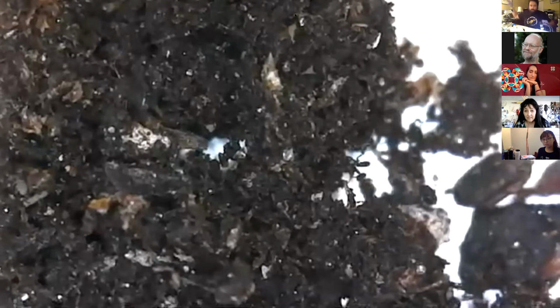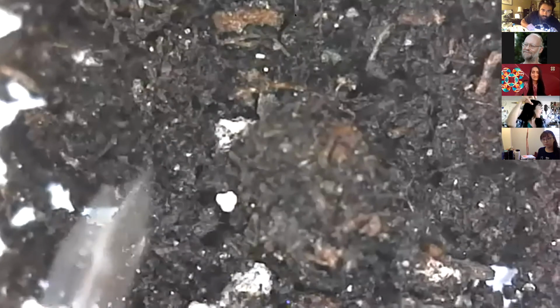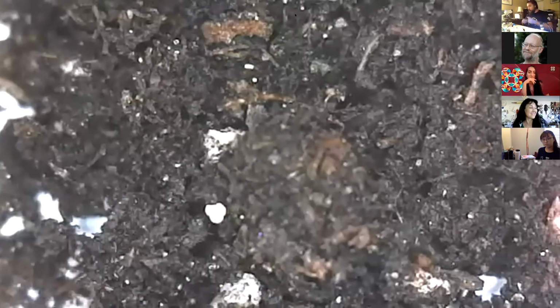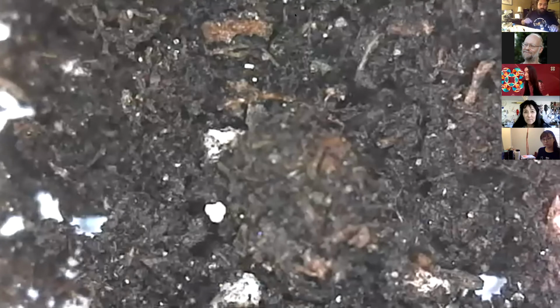So we'll use a nice little pick in my dissection kit to push this around. We'll see a little bit closer structure, all these little channels and valleys of microbiology. And yeah, this is some potting soil, probably some perlite in there as well. But we can enrich that by working with the microbiology. So anyway, I'm going to switch back over to my main camera.